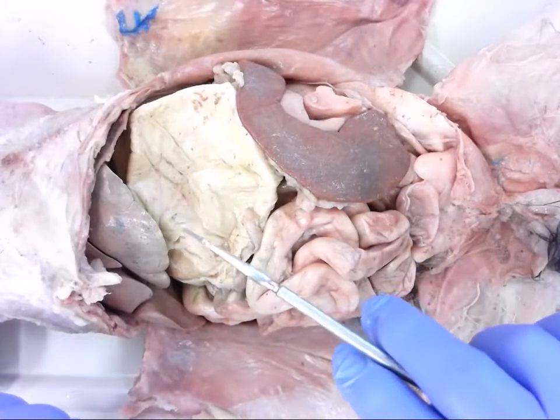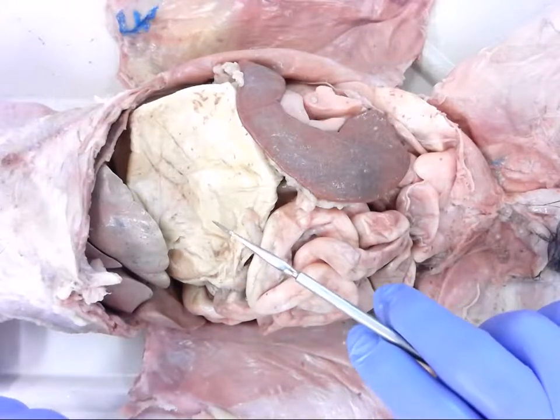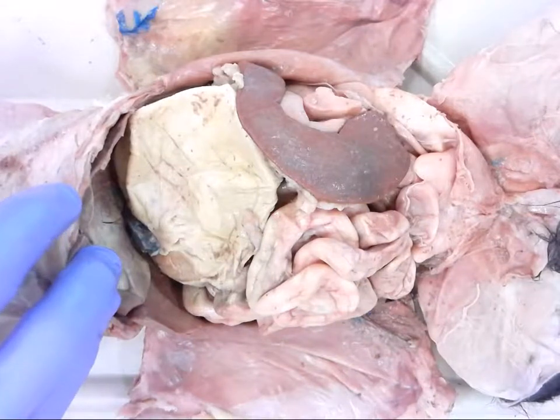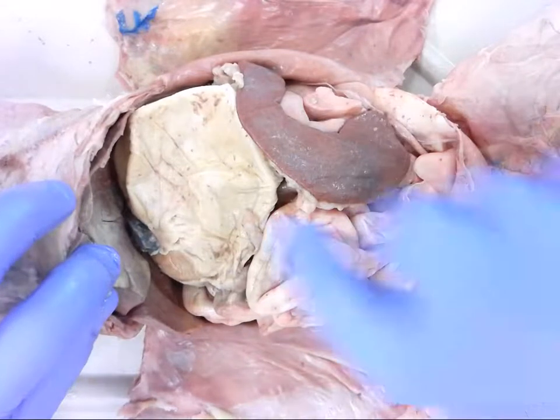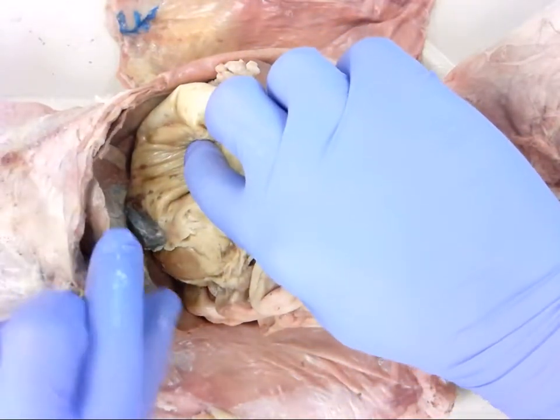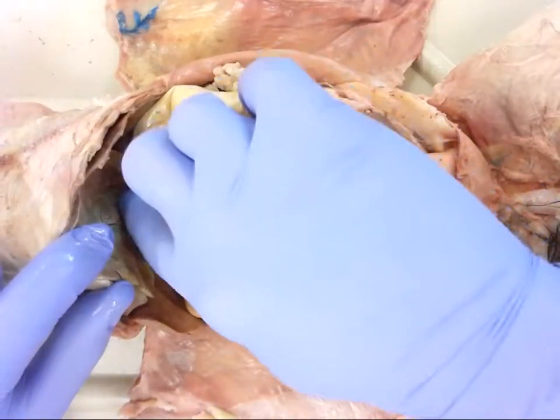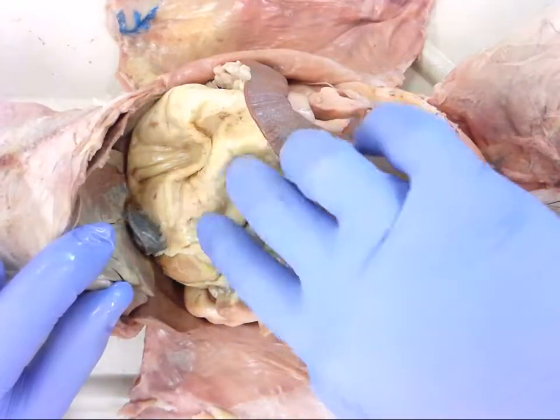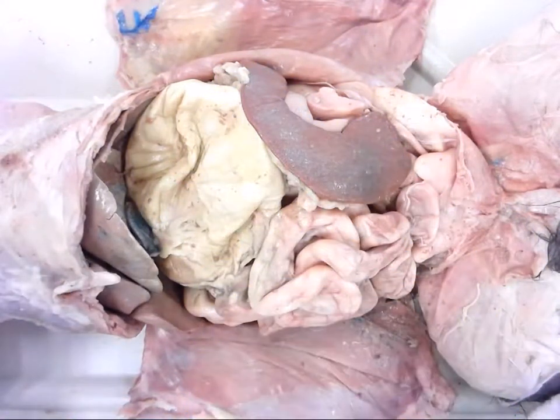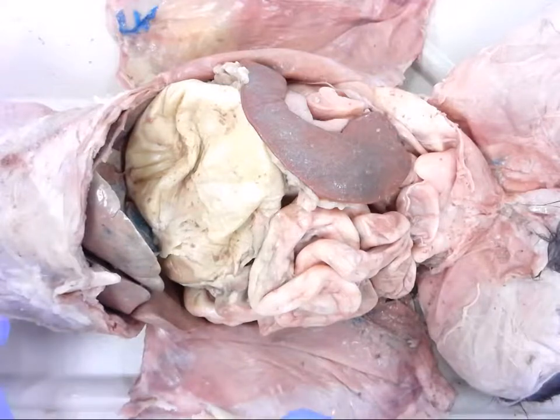The esophagus is somewhat difficult to see because it's fairly deep — it meets the stomach right after it comes through the diaphragm, and the liver also sits in the way. So finding the esophagus is hard unless we get up into the thoracic cavity, so we'll forgo identifying it here for now.